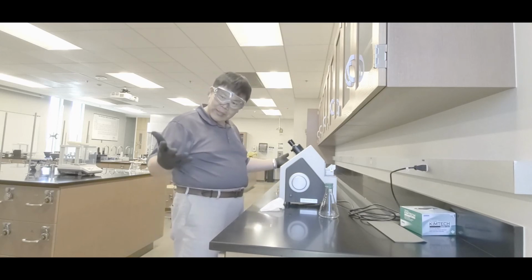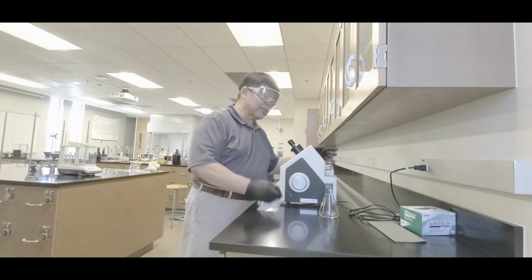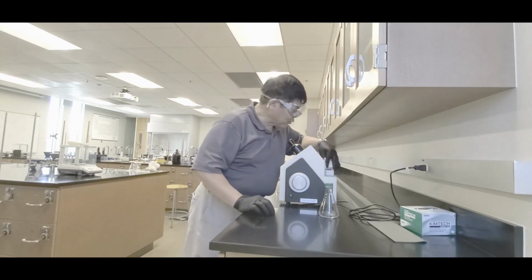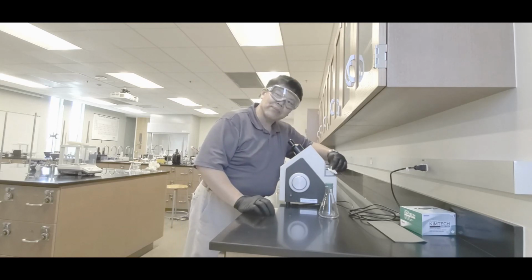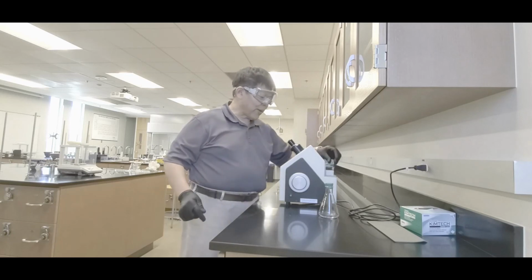Hey, you're done, yeah? Now what you want to do is this though. Don't leave it like that. Get the Kimwipe and dry up the metal block, just dab. Don't rub the window, okay? Dab the window dry. Okay, close that back down.